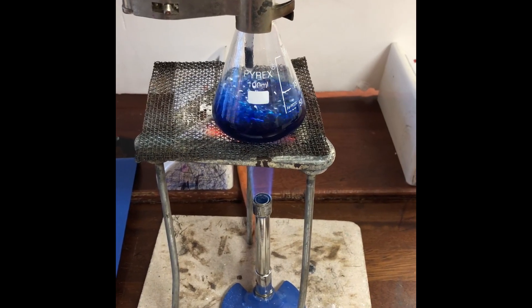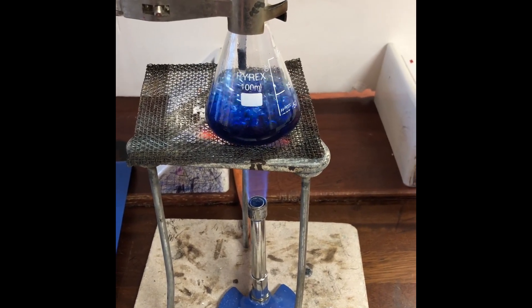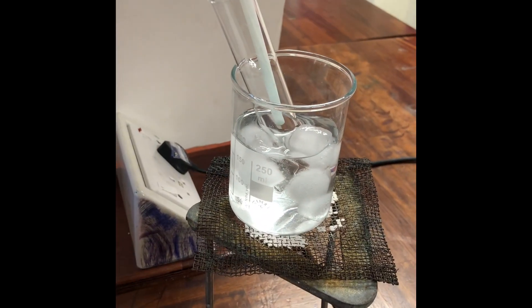So you can see we've left it on the heat and it started to boil. And now what we're going to be doing is watching to see all the pure water being collected in our ice bath.